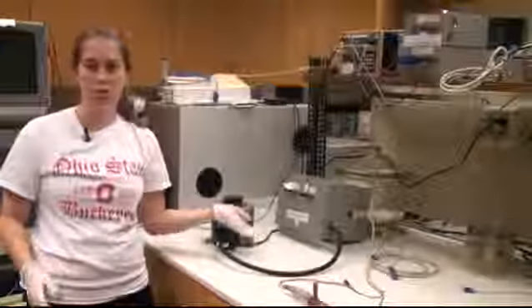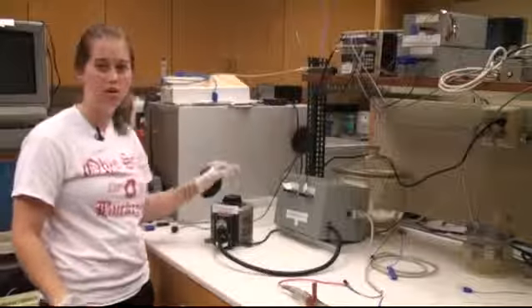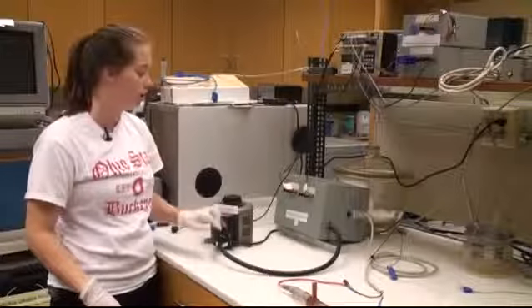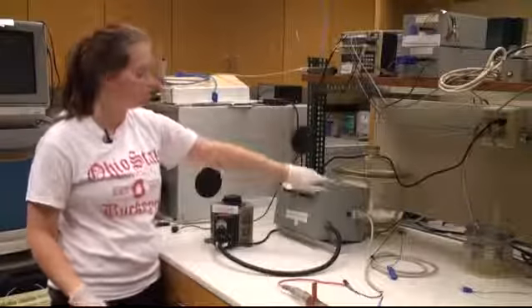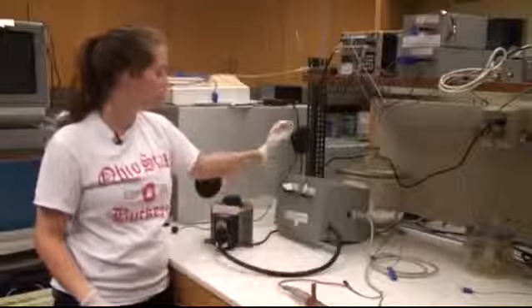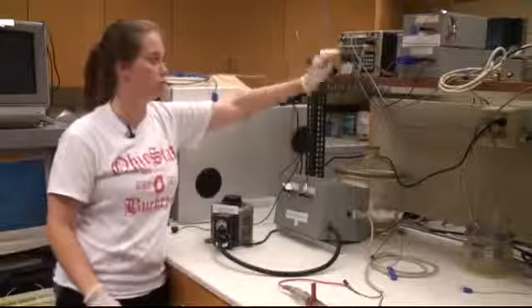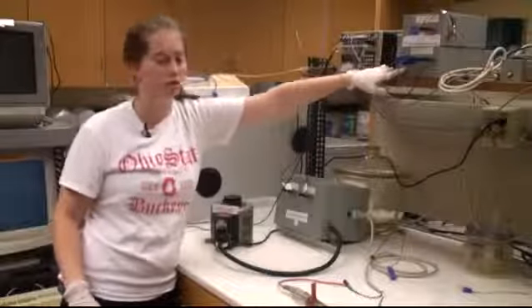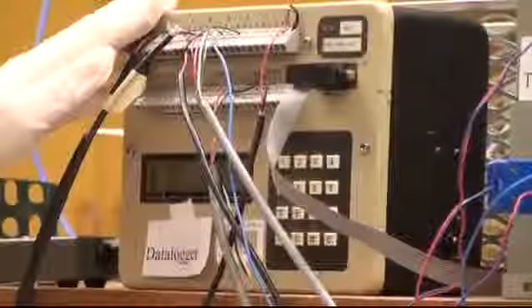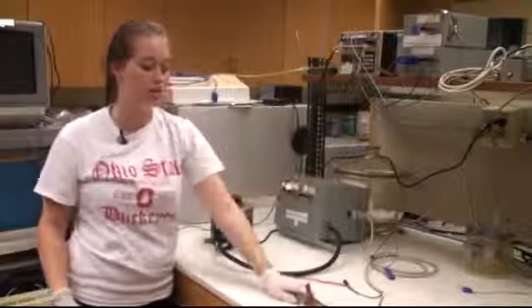This is the setup used for conductivity as a function of temperature. First, the power supply is connected through to the voltage and current sensor. The volt and current sensor is connected to the T-cell. The volt and current sensor is also connected to the data logger, as well as the thermocouple isolation modules connected to the data logger. The thermocouple from the thermocouple isolation modules is connected to the T-cell.